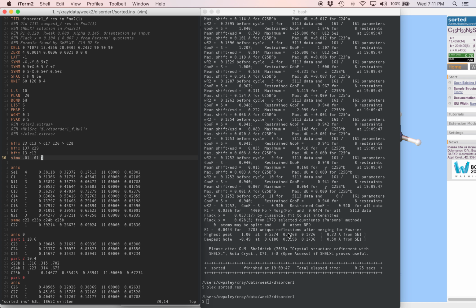fixing it, and we make that change by coming down to the part instructions and changing this to occupancy of 21 and the other will be minus 21. So remember, now we're setting the first one to the second free variable, and the second one we're setting it to 1 minus the second free variable. So we need to go up to our FVAR line. We're going to add a second free variable because the program is going to yell at us if there's nothing there.